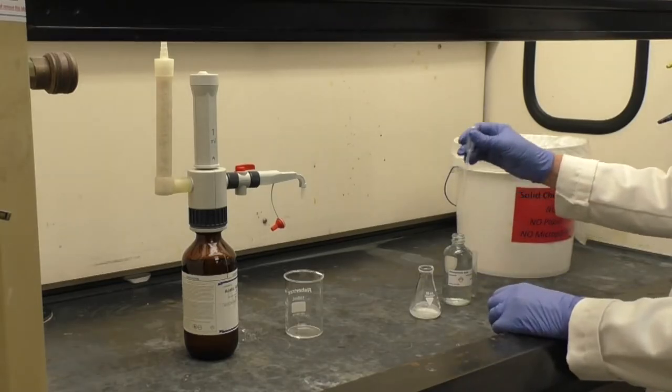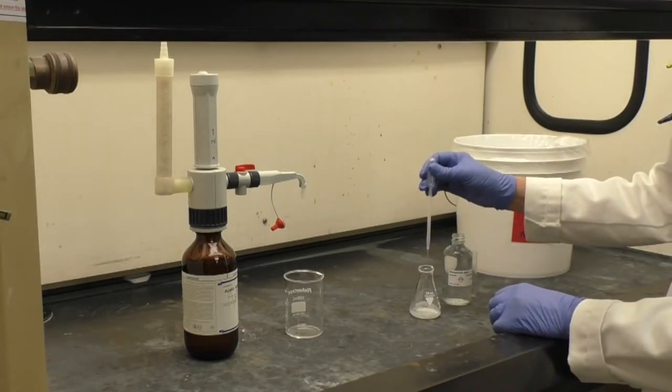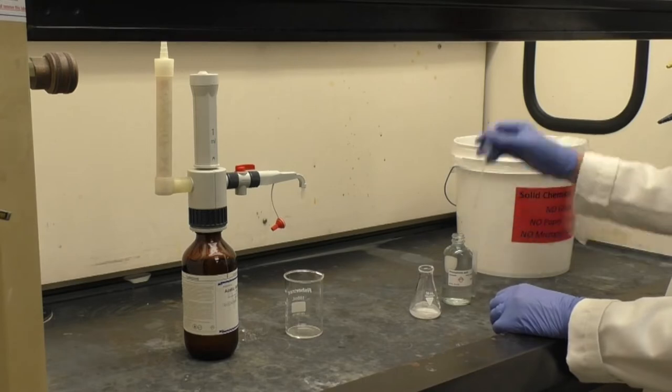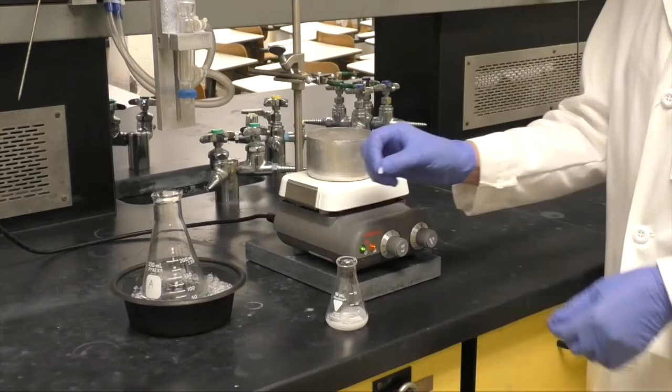Then add 3 drops of concentrated phosphoric acid and again swirl to mix.